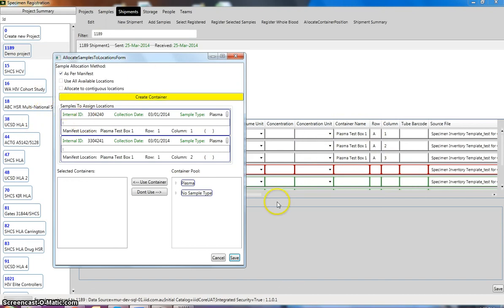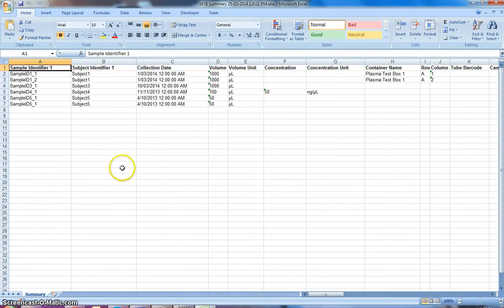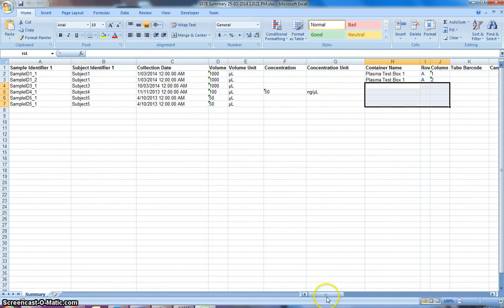Once it's been saved and that pop-up has come up, we can just go cancel, and then we have a button here that says shipment summary. If you click on that, it will give us all the information in the spreadsheet. As you can see, these two samples have been registered into this container, and these are the positions they will sit in. It also lists all the other samples we've registered, but you can see that they have not been allocated a container as yet.